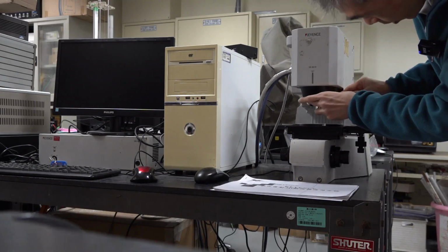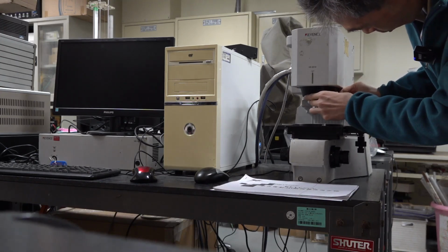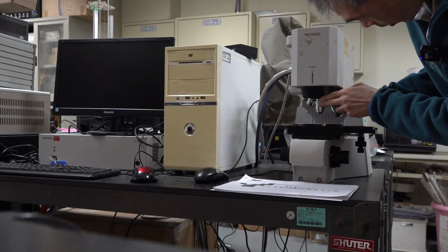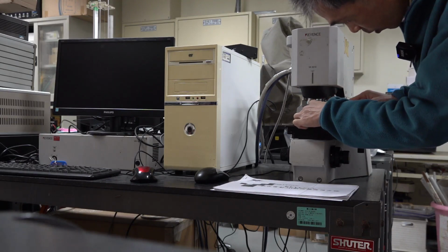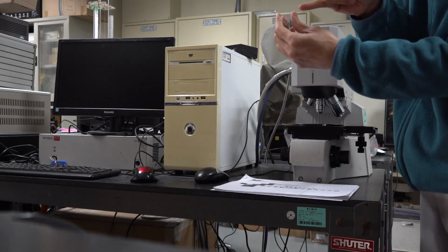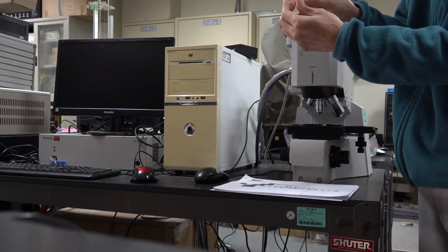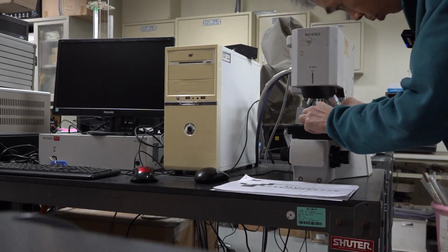So when you rotate this table, you will feel a small click. Then you know it's in the right position. And we put our micro device, see the die, 1.5 millimeter times 1.5 millimeter, on a glass slide. And we put it under the microscope.